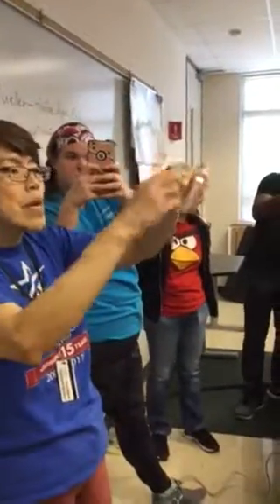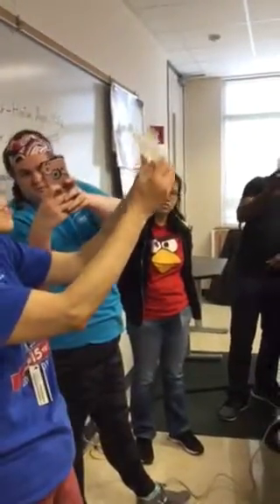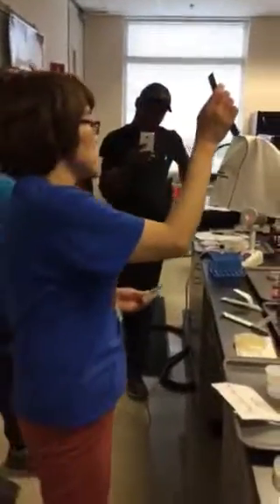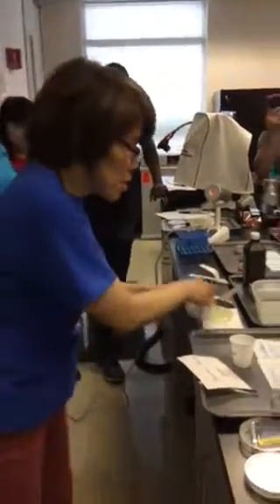One also has a little zone of inhibition, but when you do yours, you have nothing to compare with. So how do you know if your bacteria is sensitive or resistant? You take the ruler and you measure the diameter all the way across, either way, okay? Measure the diameter in centimeters, multiply by 10 to get millimeters, and then I'll give you a reference number for you to compare.